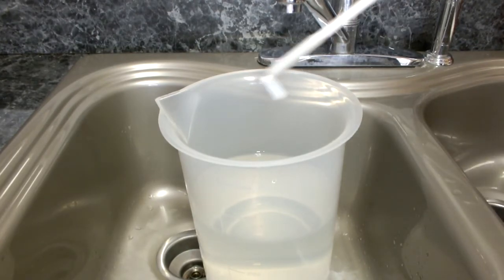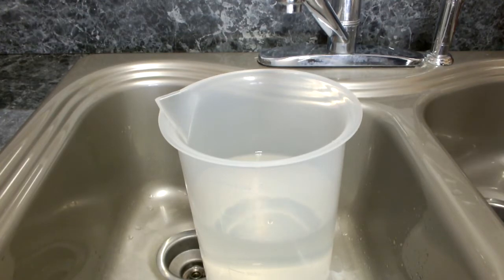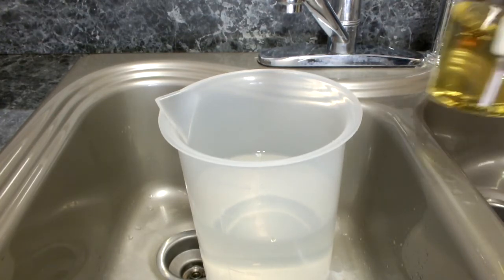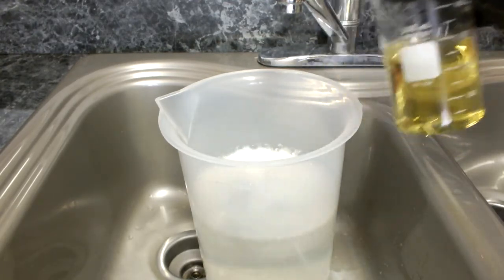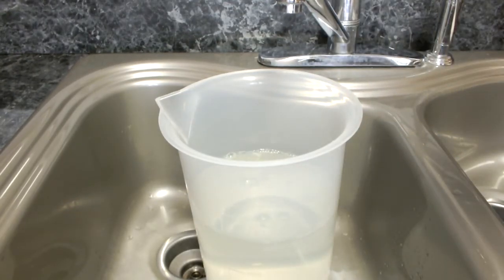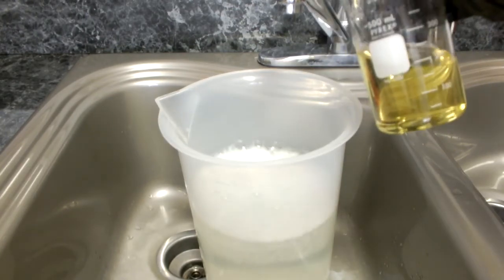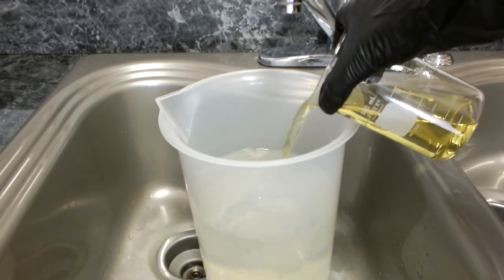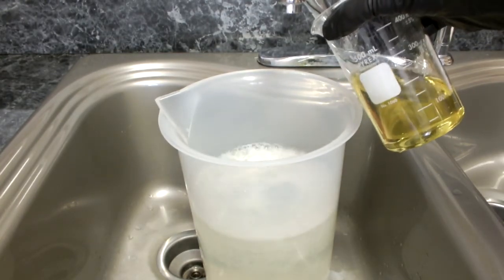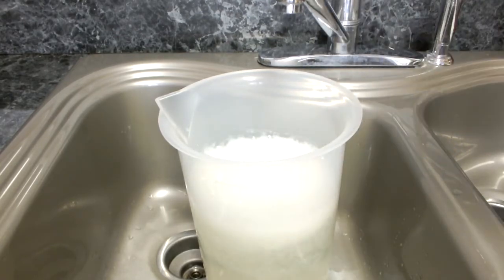Give the stir bar a quick dunk. And notice the addition of gloves. It's important to wear heavy gloves whenever you're working with concentrated acids or even dilute solutions of the strong acids. Sure, as long as you wash off any spills or drips quickly, you'll be fine. But why take the chance when gloves are cheap and easy to get? Anyway, pour the acid solution into the sodium bicarbonate solution slowly to avoid it going over the top. That's also why I don't fill the 5-liter beaker past 3 liters.